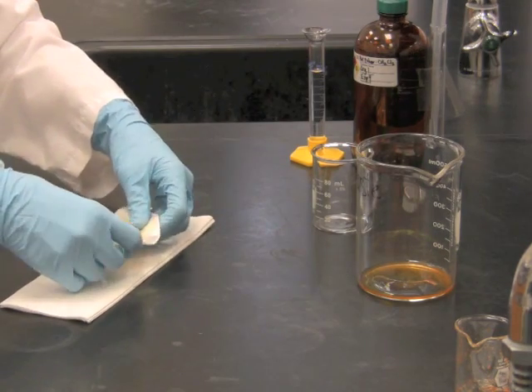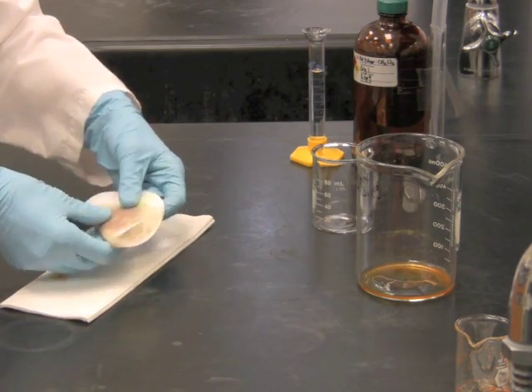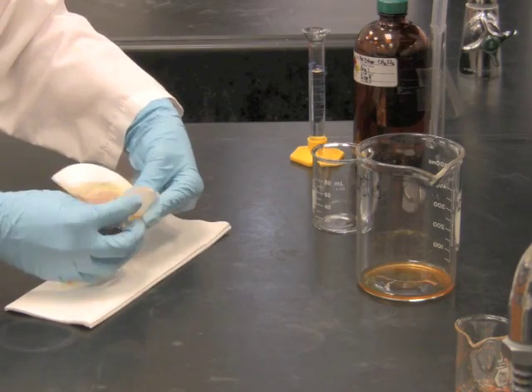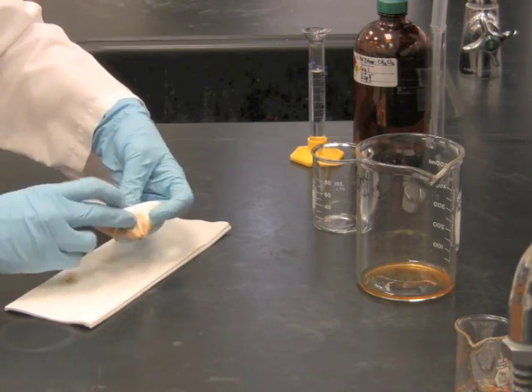Put this in between a couple of pieces of paper towels to absorb more moisture and be careful not to tear the filter paper.